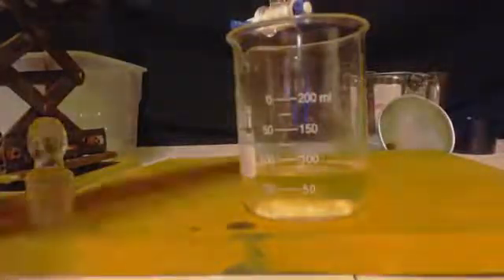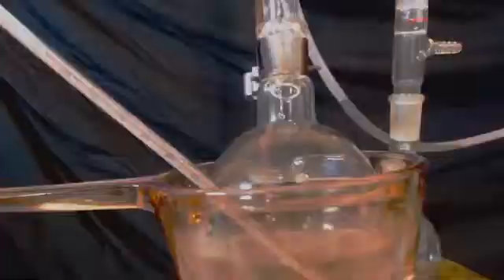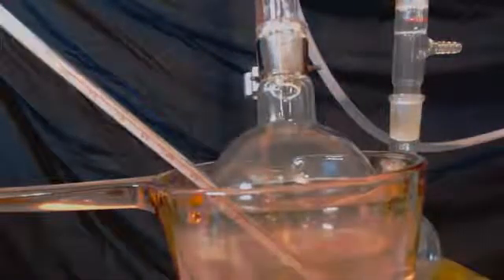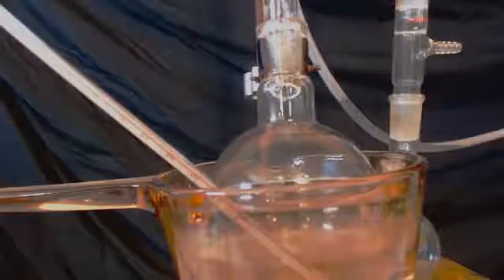Last time, I got 60 milliliters. This is a little bit better. Now, this is where the things change. What I did last time was I just basically dried it out like you'll see, and it'll clear it up nice and crystal clear, and I just fractionally distilled it, and boiled out everything at 110 to 112 degrees, and I only got 5 milliliters, so that wasn't such a great idea.